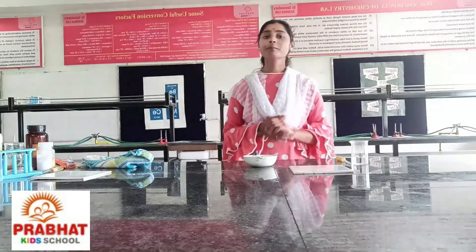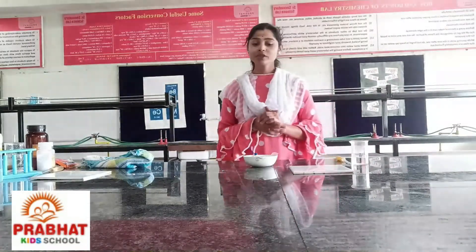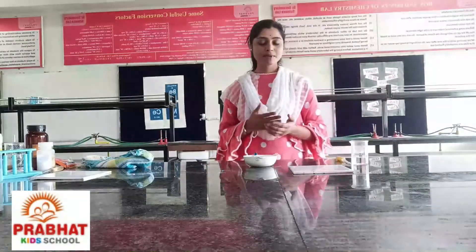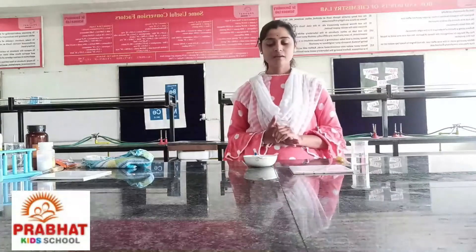Hello students, I am Priyanka Manikra from Prabhat Kids School, Akola. Today, I am going to conduct one experiment. This experiment is based on acid, bases, and salts.